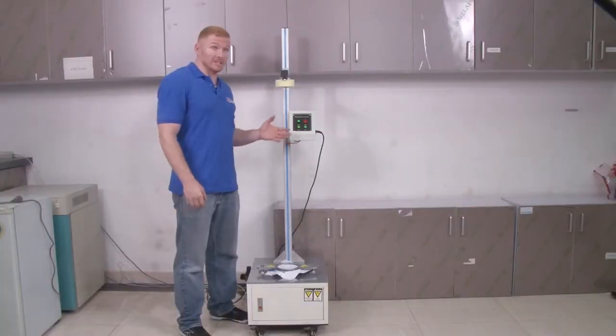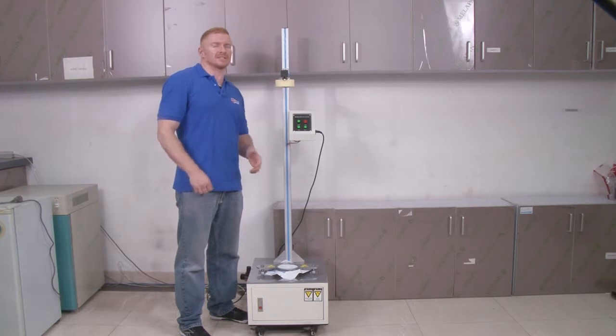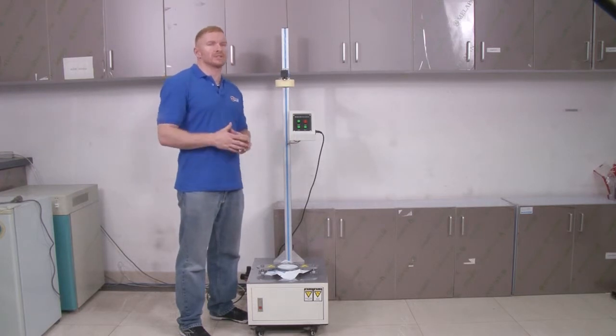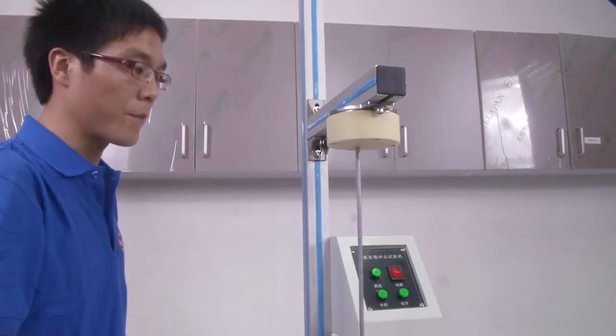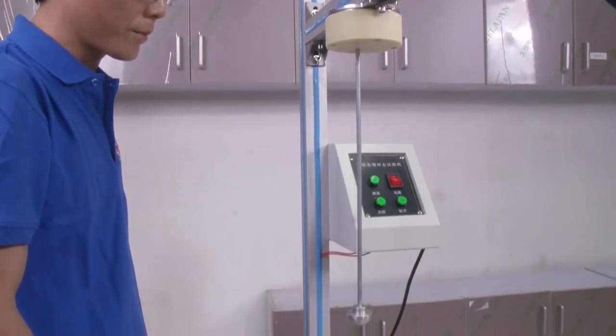This procedure is for testing falling dart resistance. The film should be strong enough to withstand impact on both the inside and the outside. We need the dart impact tester to test how much weight can be withstood by the package film.